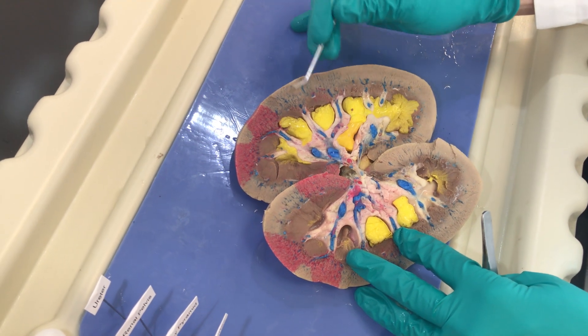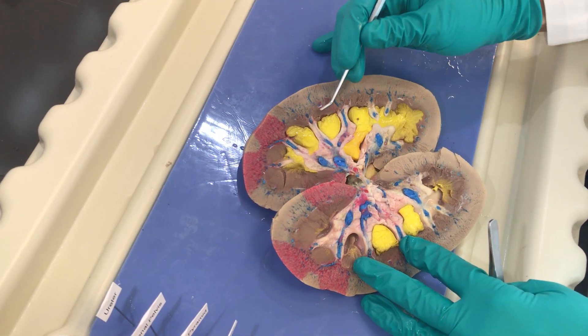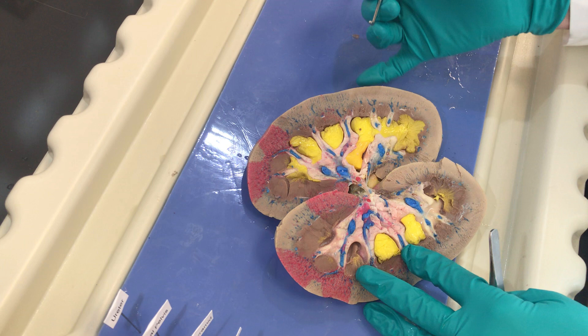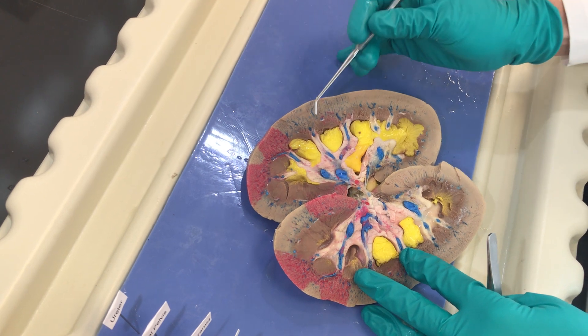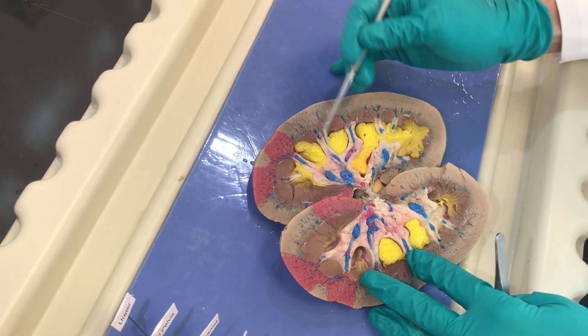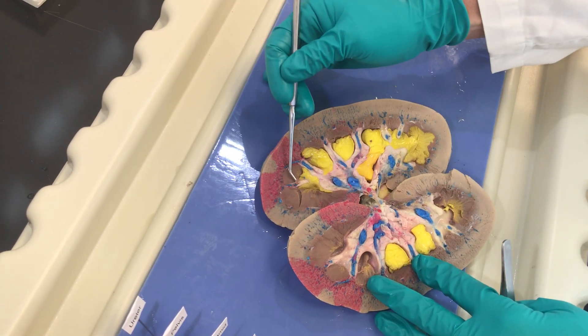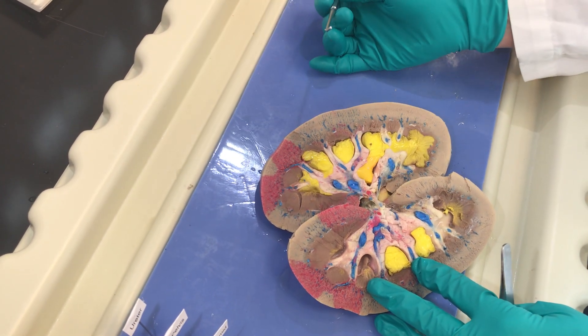So again, cortex and medullary pyramids. You can appreciate that the cortex does extend in between the medullary pyramids, so do appreciate that.